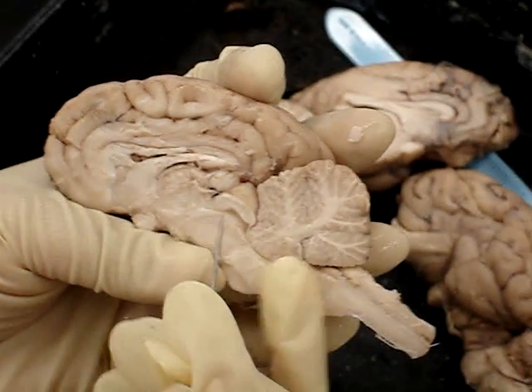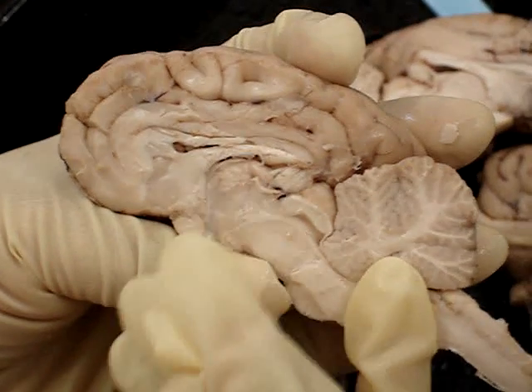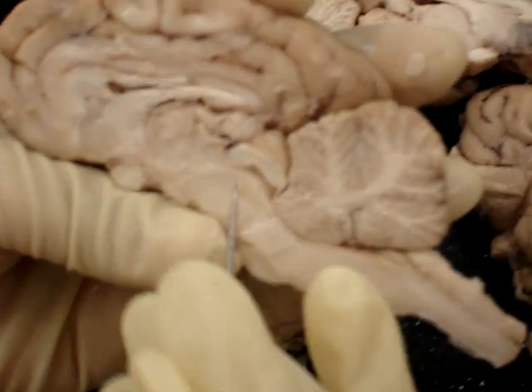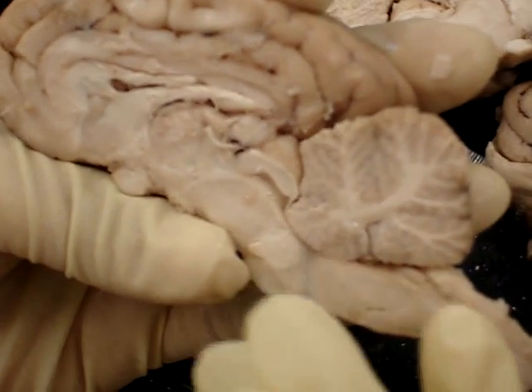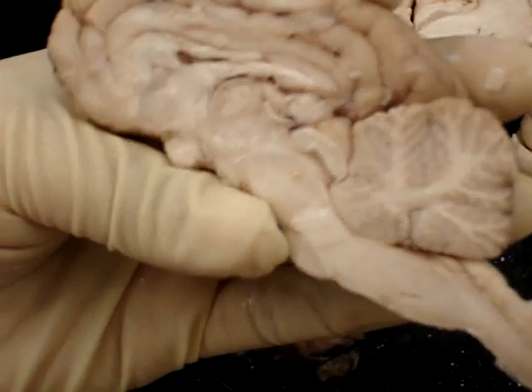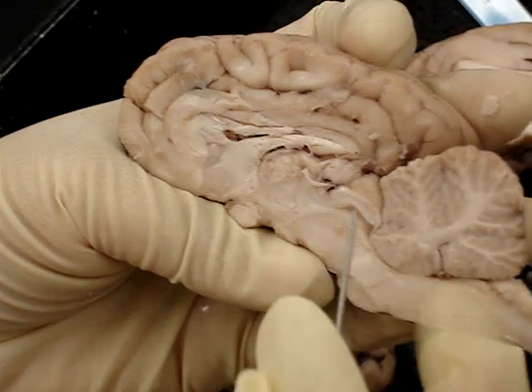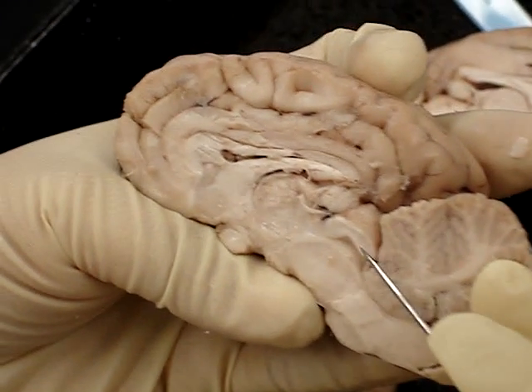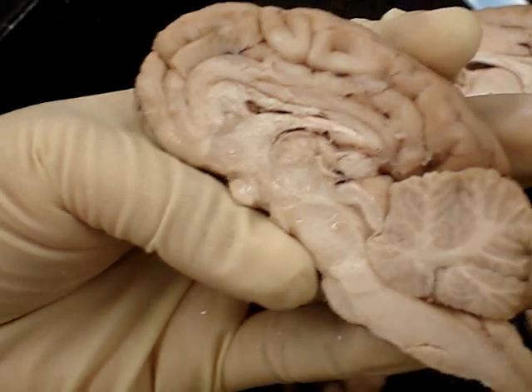The aqueduct is actually the cerebral aqueduct, and it goes from the third ventricle — it connects the third ventricle and the fourth ventricle. This is the cerebral aqueduct, runs down here. In this sagittal view, this is the inferior colliculus. So there's the cerebral aqueduct; above it is the inferior colliculus.